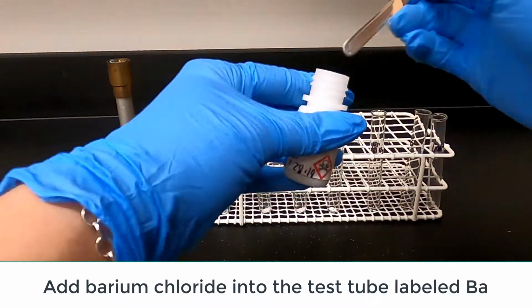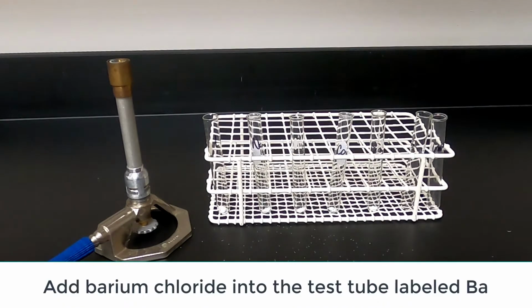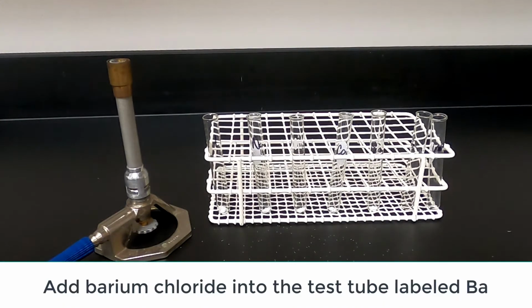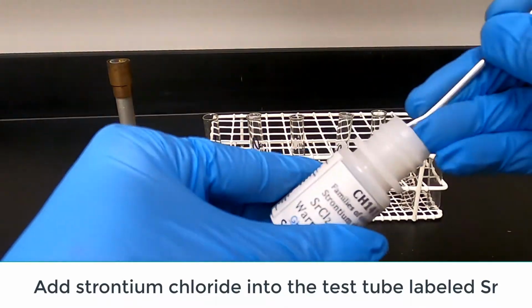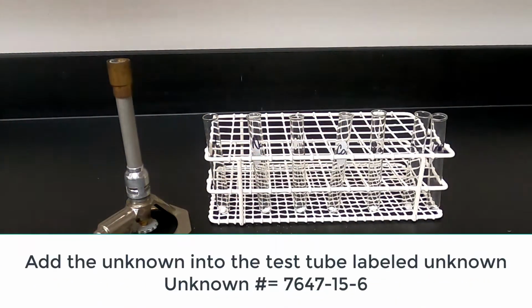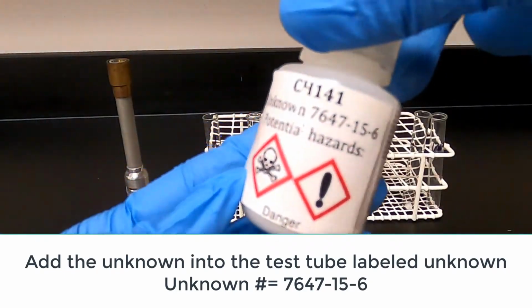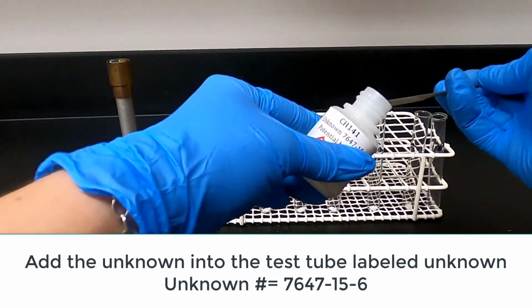Add barium chloride to the test tube labeled barium. Add strontium chloride to the test tube labeled strontium. Add the unknown into the test tube labeled unknown. Record the unknown number on the datasheet.